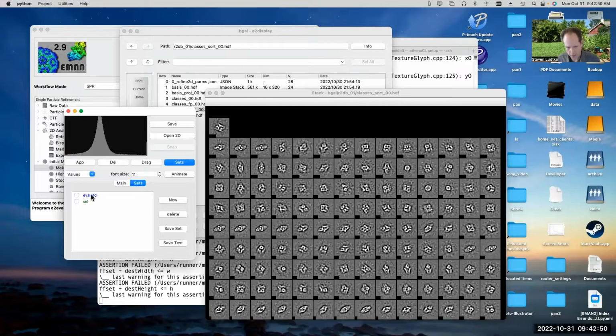Okay, so I actually already made a selection here, which was a previous selection that I did. So if I check this checkbox here, you can see these green marks appear in the upper corners of the particles that I picked. If we pick a set and we want to add one of these class averages to the set, like say I wanted to include one of these things which could be an end view, I just single click on it and I can toggle it on and off.